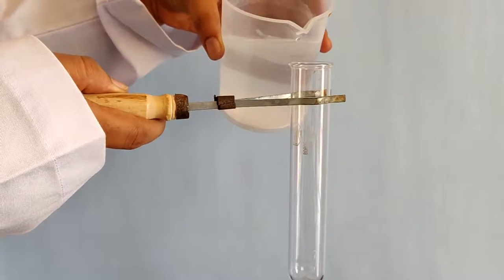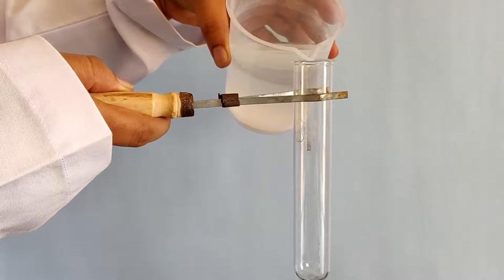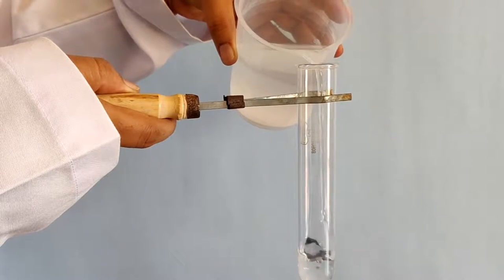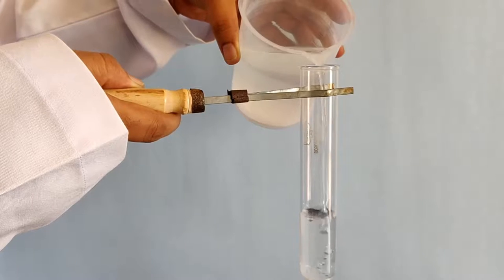Carefully pour some of the clear liquid on the top into a large test tube without disturbing the sediments in the bottom.